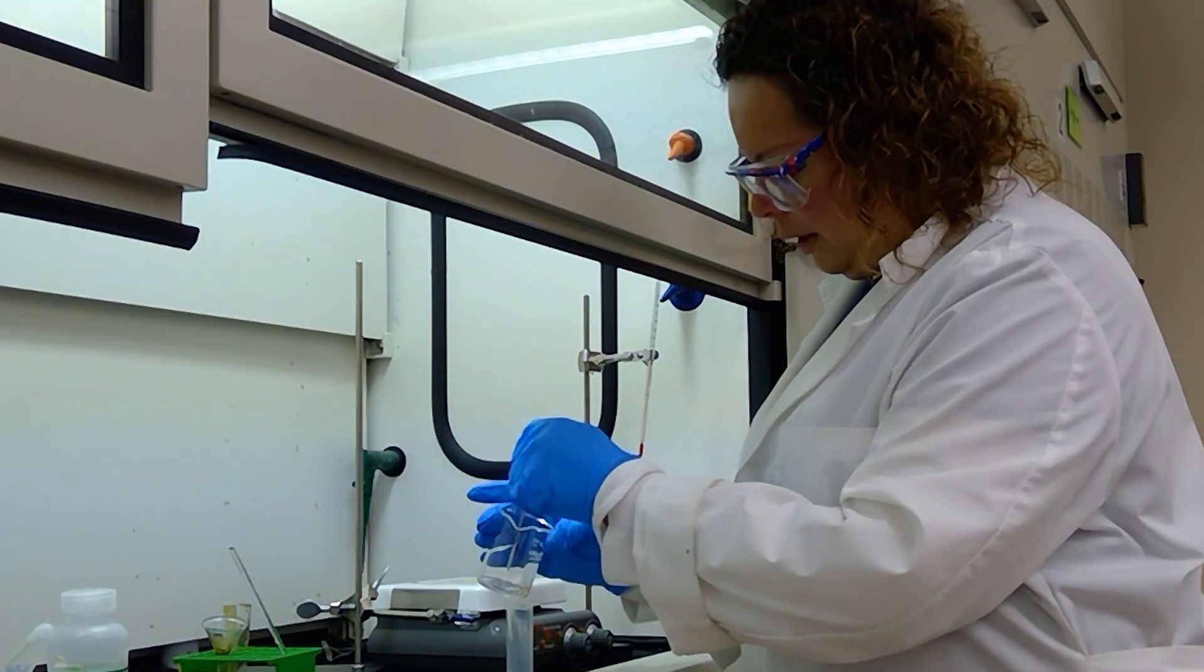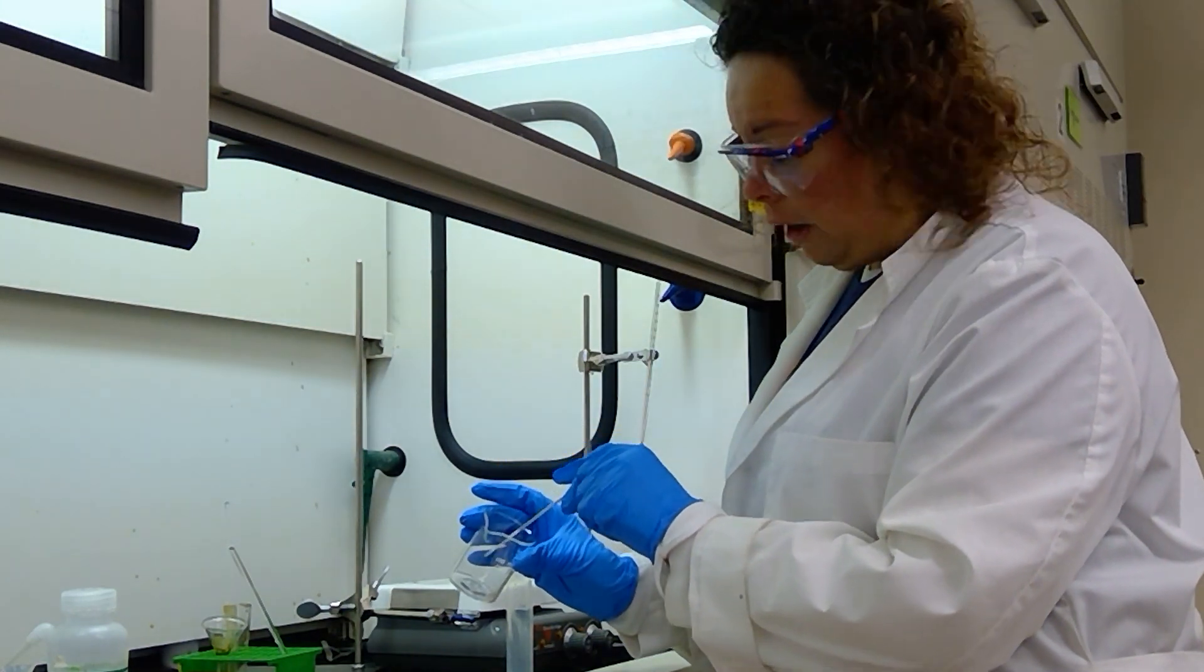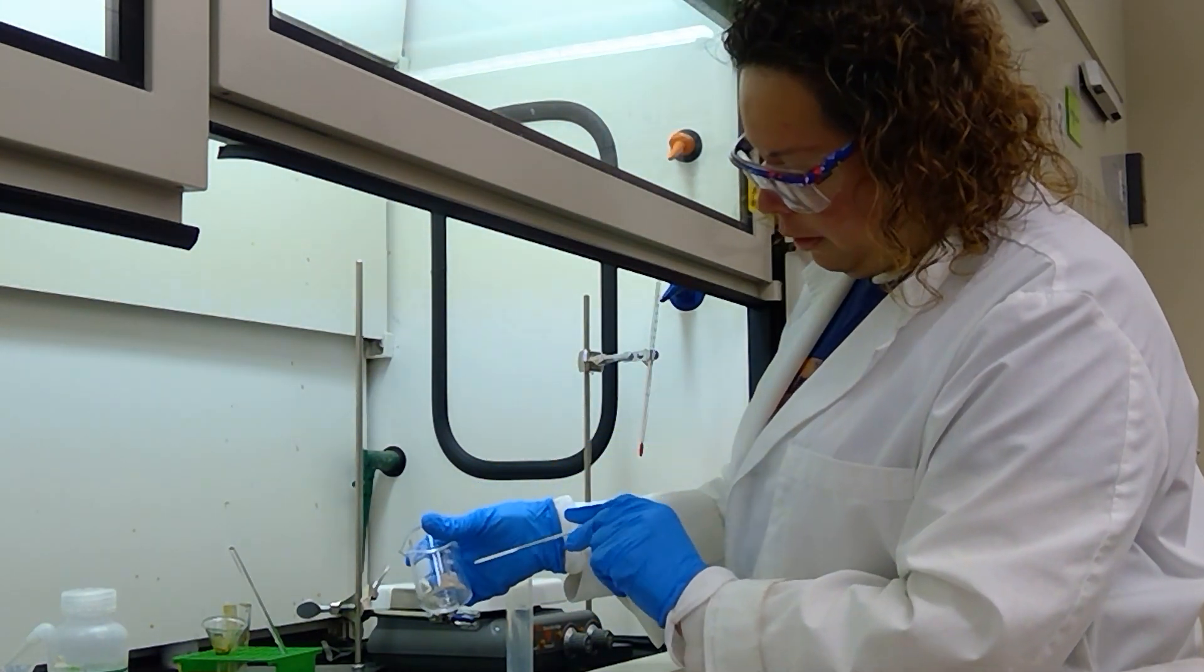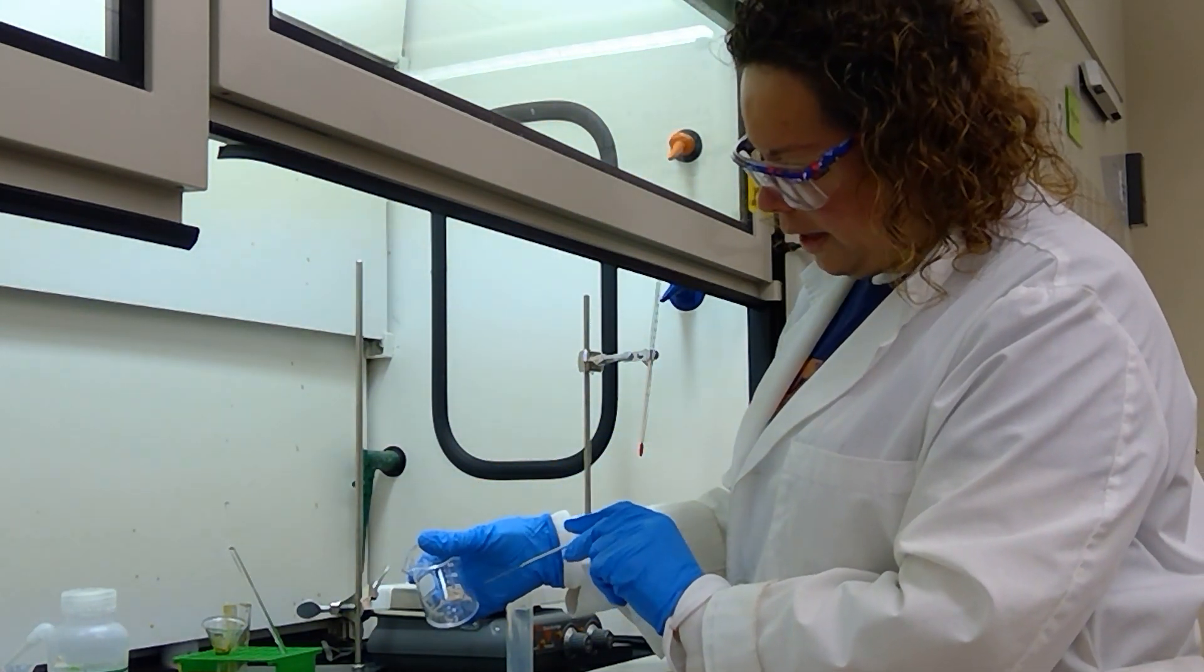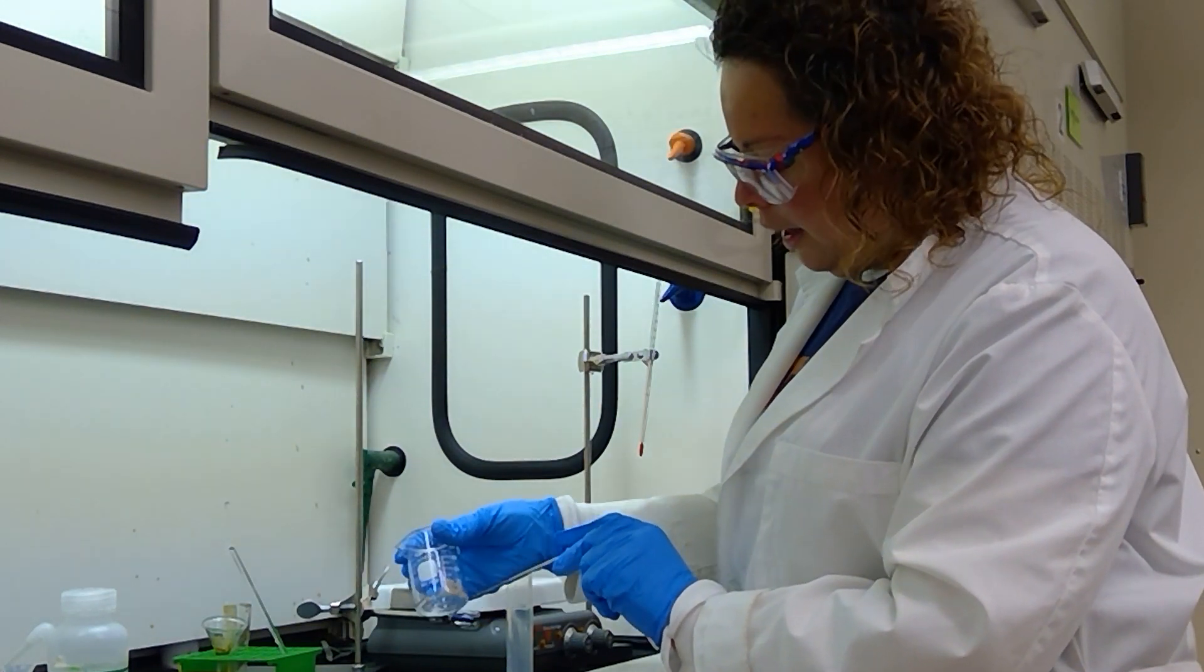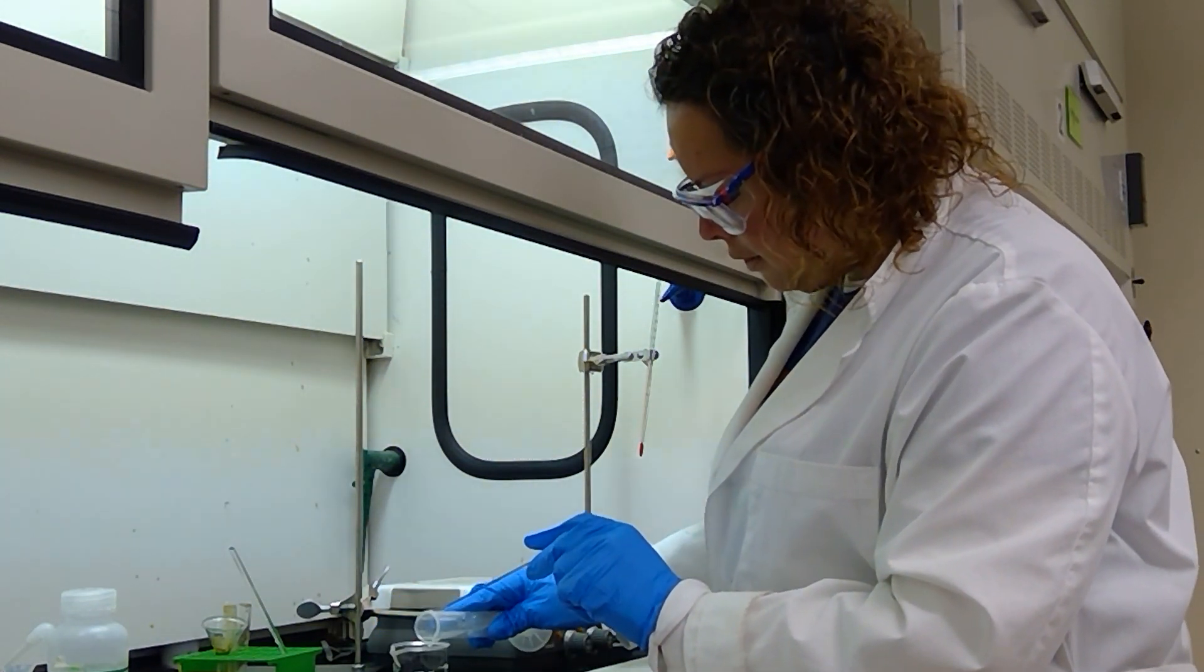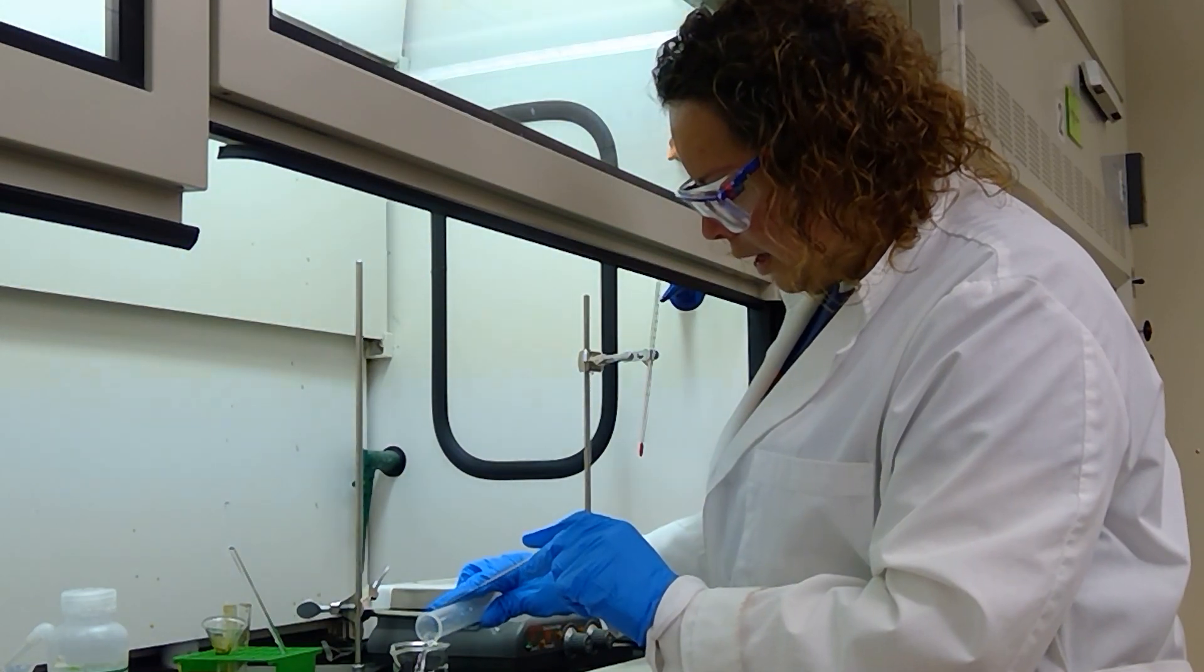So I have measured out 200 milligrams or 0.2 grams of the 2-naphthol compound, and if you notice here, it's quite chunky and large flecks. And so I'm going to go ahead and add my water solution to this and stir it up as best I can.